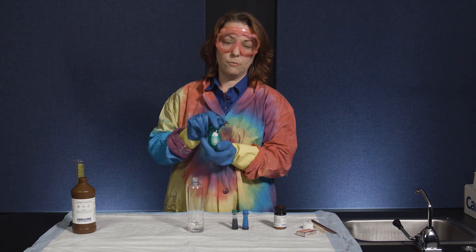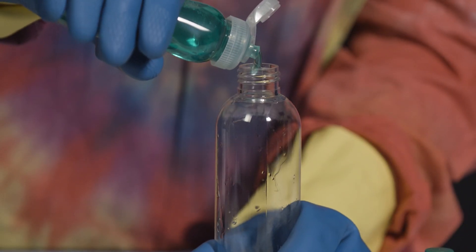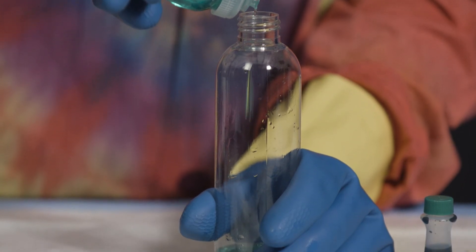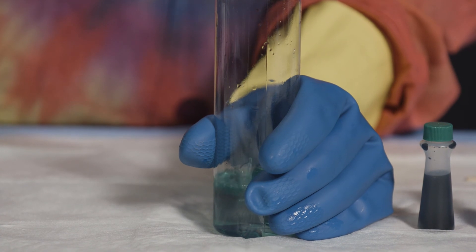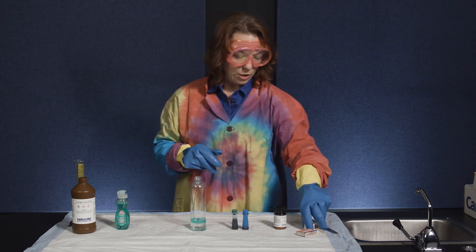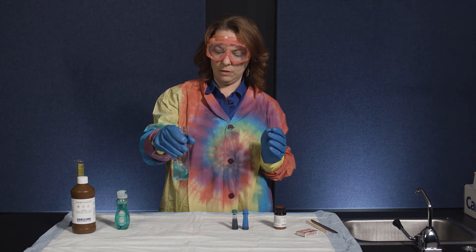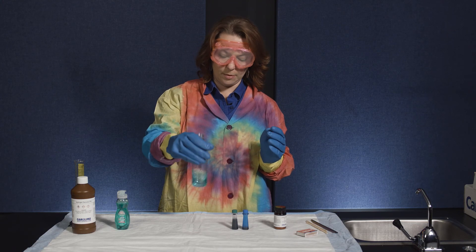The second thing we're going to add is some regular dish soap — about 20 drops or so. We're adding the dish soap because we're going to evolve oxygen gas, and the dish soap is going to allow us to see that oxygen gas a little more. Once it's in there, give it a little swirl so the dish soap doesn't form a layer on top of the peroxide.